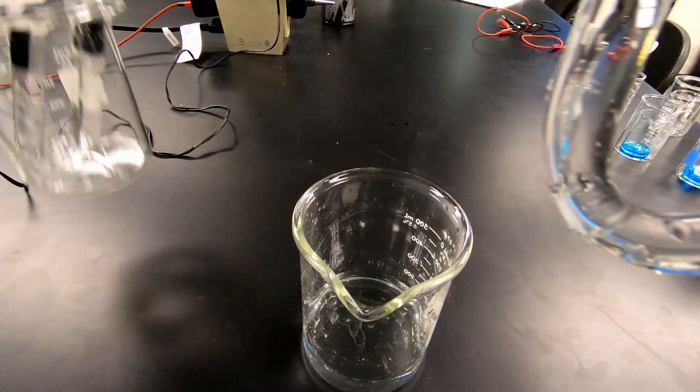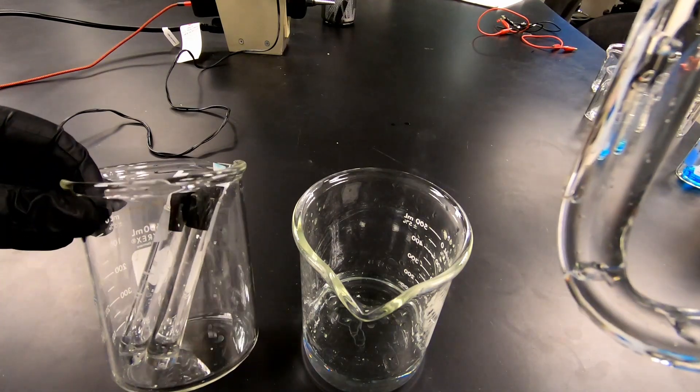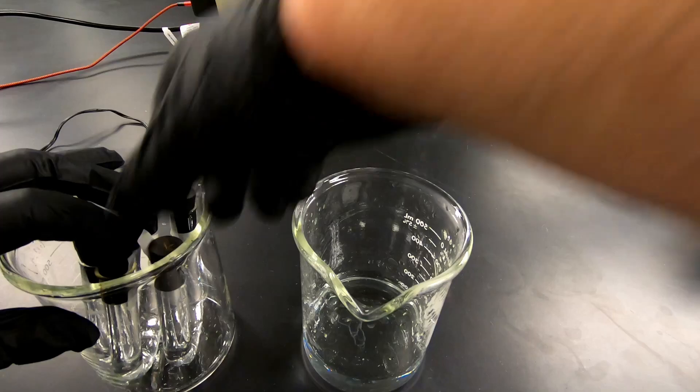And then I like to use another waste beaker just to, as a container for my salt bridge. So you can just drop it in there like that.